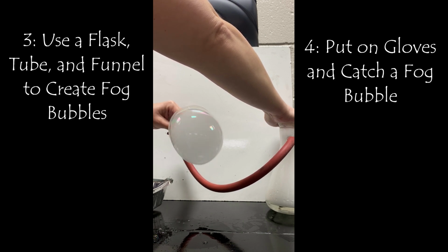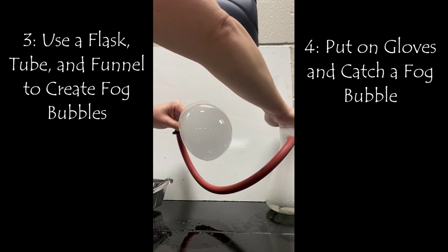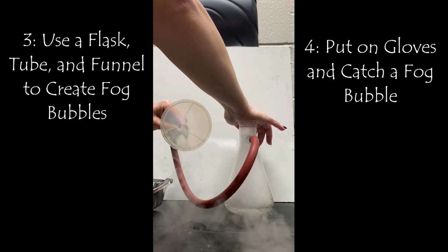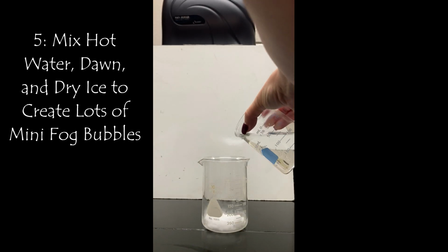All right, the next experiment that we're gonna do is always the one that I like to do last. And I like this one because it's so interactive with my students. So what I do is I go ahead and I get a beaker. You can make a large one if you want, but I just go with a pretty standard size beaker so that I can pass it around and move it around the classroom readily.